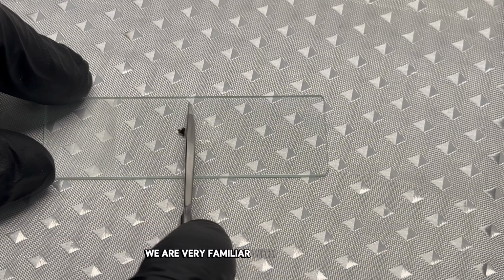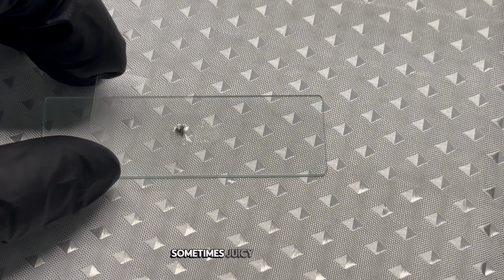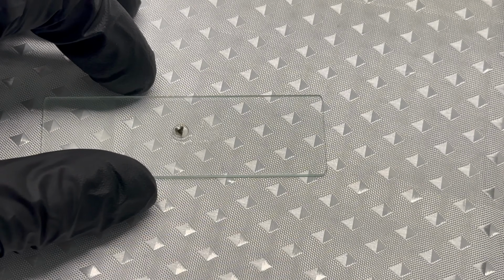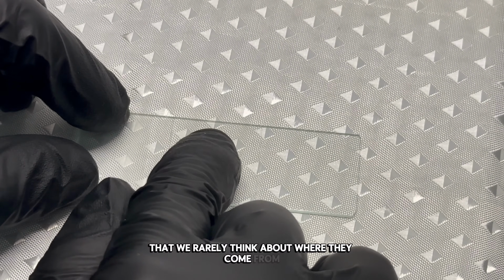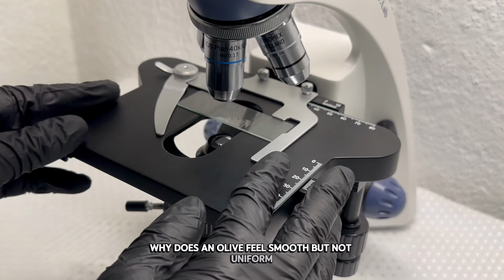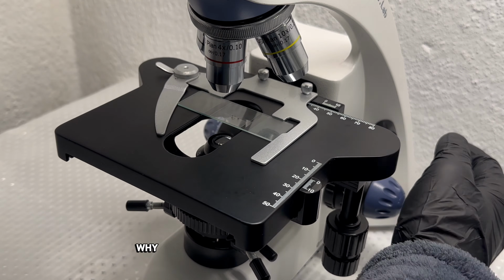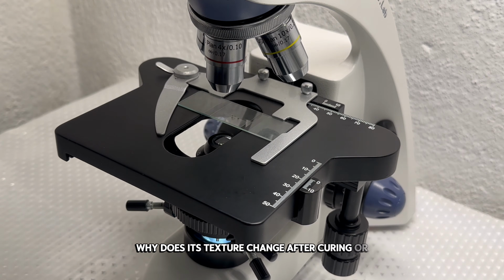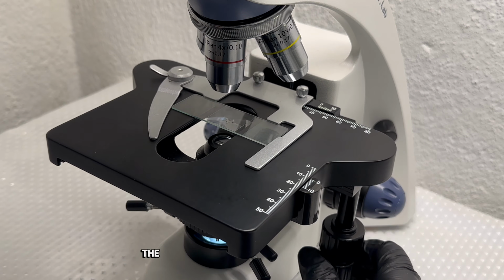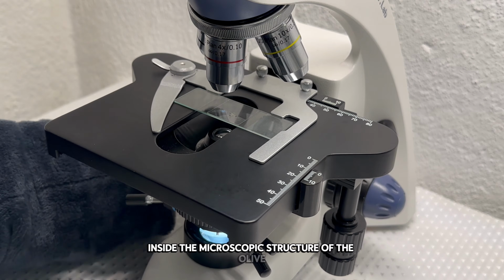We are very familiar with how olives feel. They can be firm or soft, slightly elastic or dense, sometimes juicy, sometimes oily. These sensations are so common that we rarely think about where they come from. Why does an olive feel smooth but not uniform? Why does it release oil when pressed? Why does its texture change after curing or fermentation? The answers to these questions are hidden inside the microscopic structure of the olive.